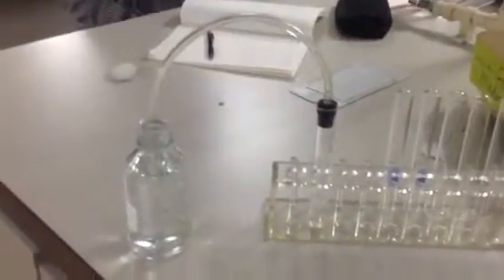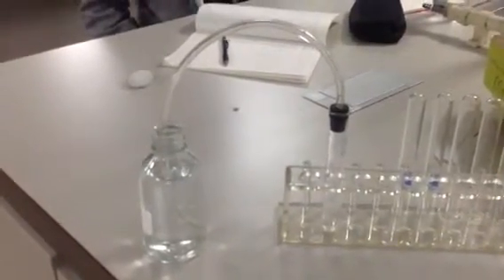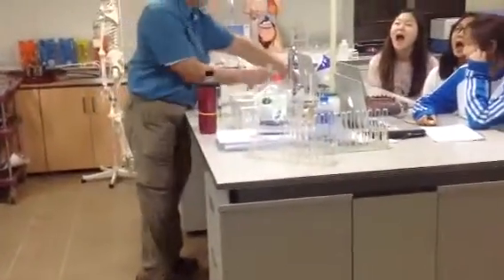Mr. June, yes. You can find the volume by using a eudiometer, if you want to. Here's what Mr. June's discussing. He's going to take one of these tubes and fill it full of water. That's not a big enough bottle. He's going to get a bigger bottle to put the water in. Pardon me while I do that.